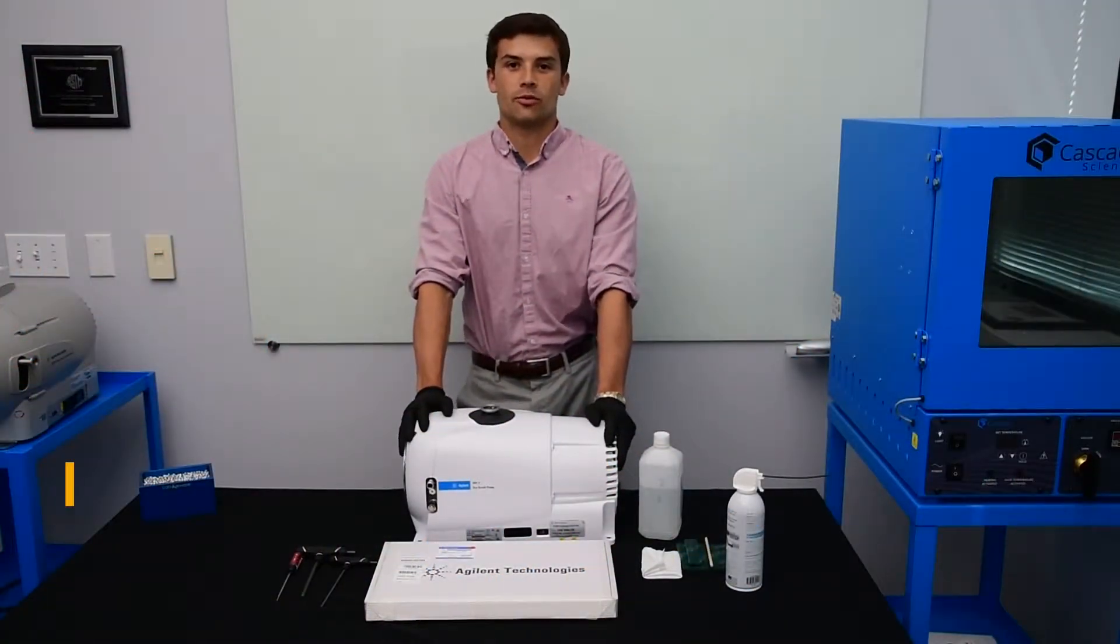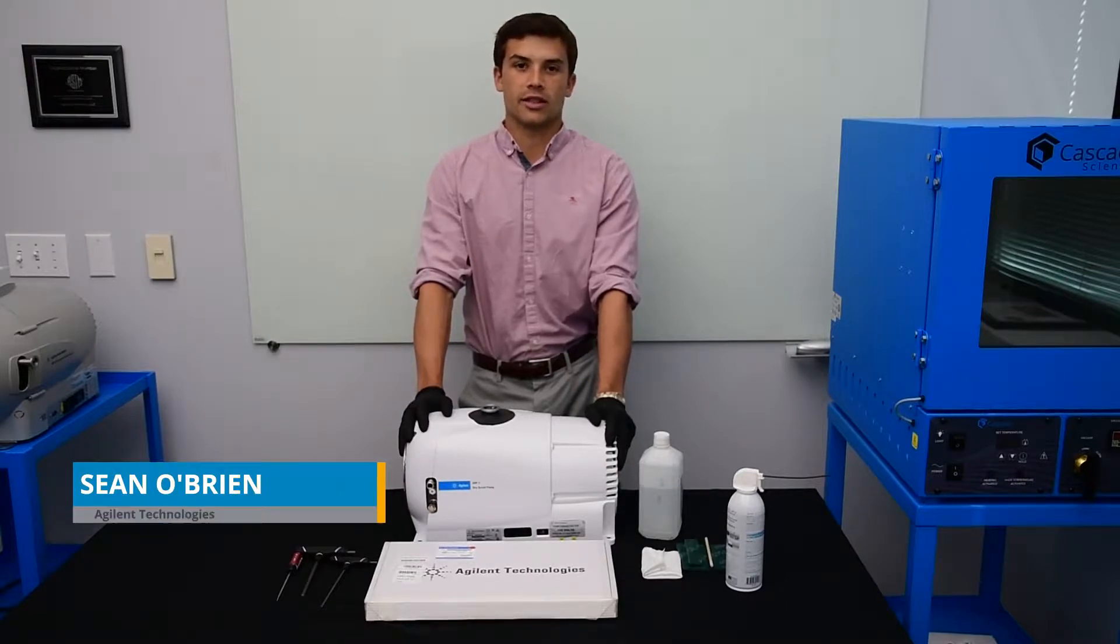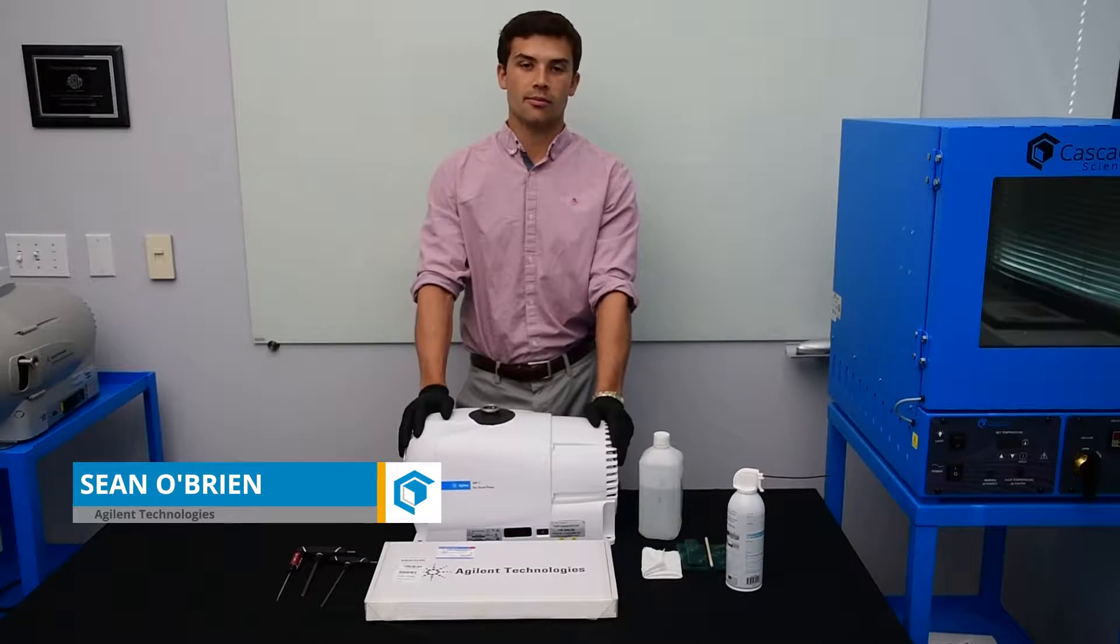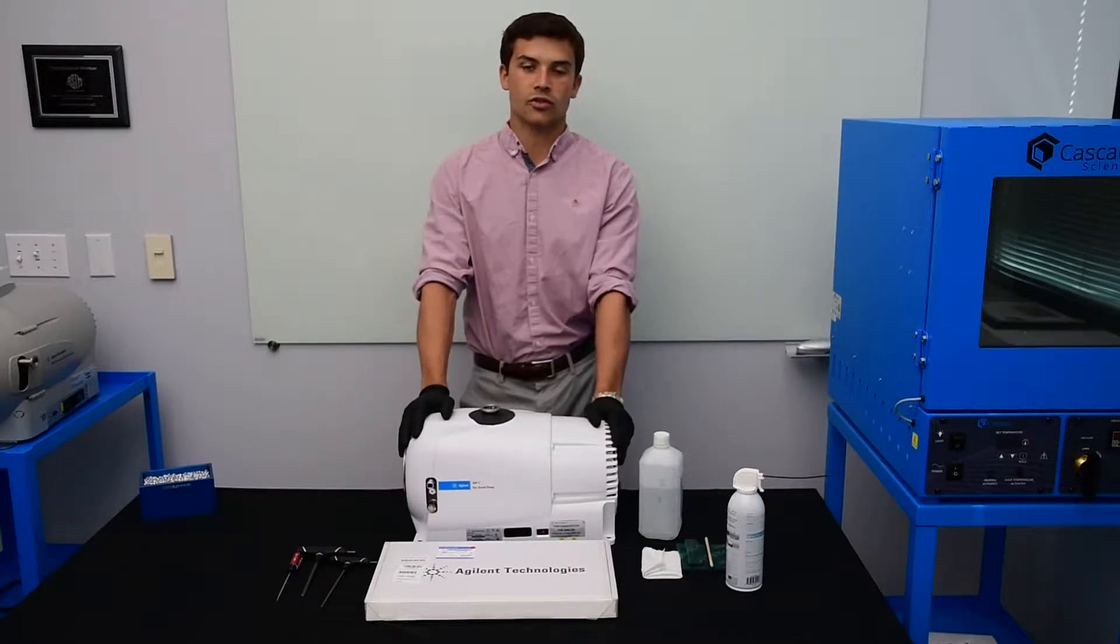Hi, my name is Sean O'Brien and I'm with Agilent Technologies. I'm here today at Cascade Sciences to talk to you about pump maintenance on an IDP7 dry scroll pump.